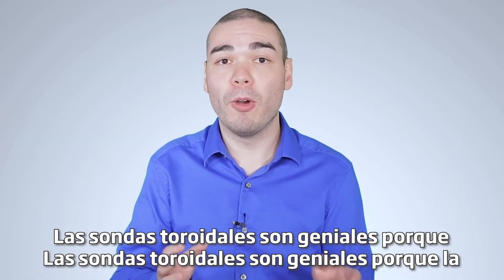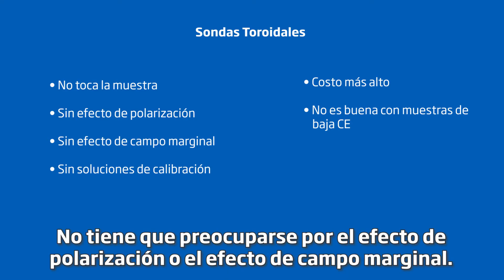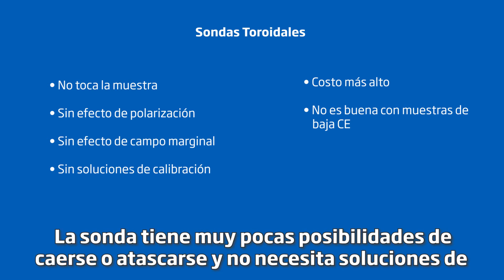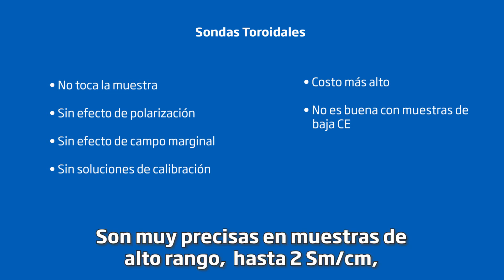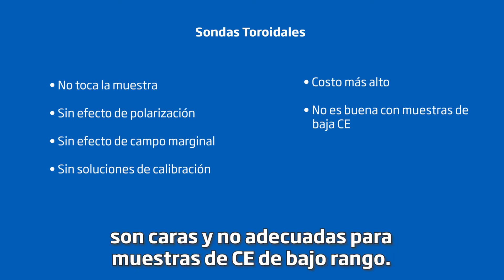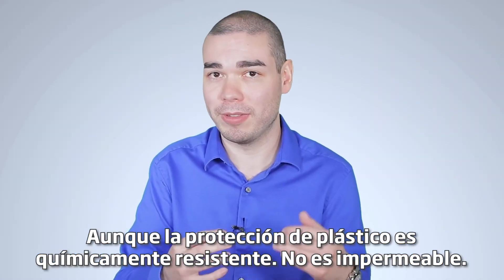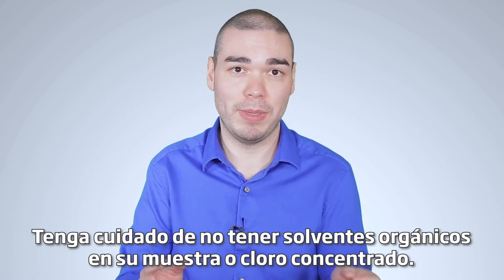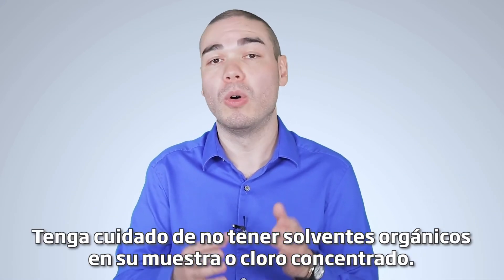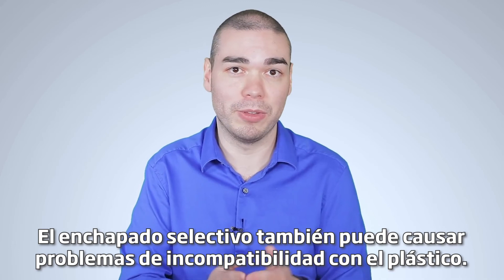Toroidal probes are great because the probe never actually touches the sample, since they are encased in plastic. You don't have to worry about the polarization effect or the fringe field effect. The probe has a very low chance of fouling or getting clogged, and you do not need calibration solutions. They are very accurate in high-range samples, up to two Siemens per centimeter, and the plastic body is chemically resistant. However, toroidal probes are expensive and not suitable for low-range EC samples. Be careful not to have organic solvents or concentrated chlorine in your sample, as select plating baths can also cause compatibility issues with the plastic.